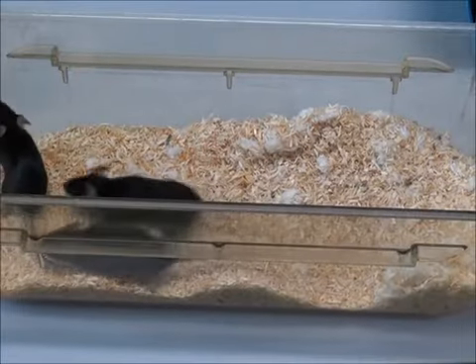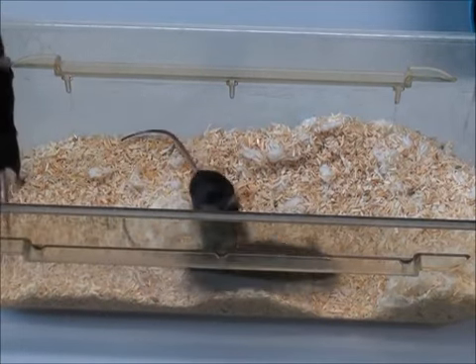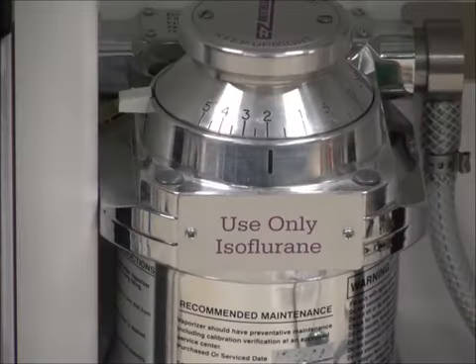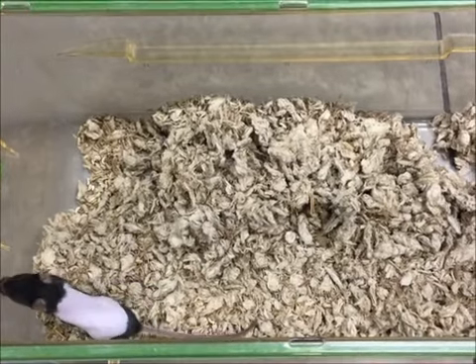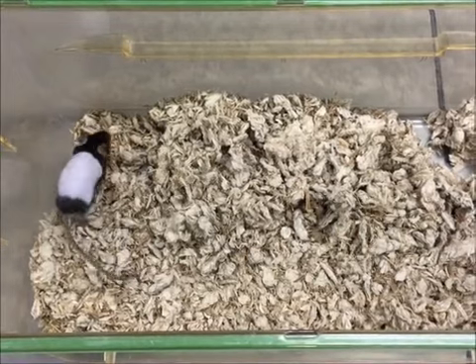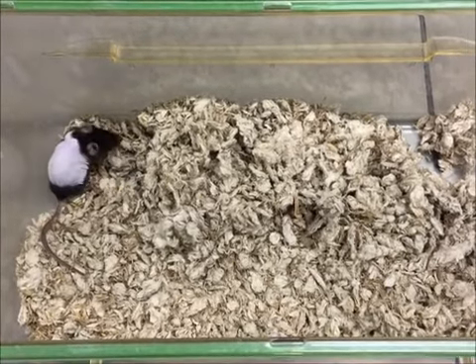Both FMT and µCT are built to image mice. Before imaging, mice are anesthetized with isoflurane. For the FMT scanning, the hair of the mouse needs to be removed, which works well with dehairing cream. Some strains of mice can develop rashes from the dehairing cream.